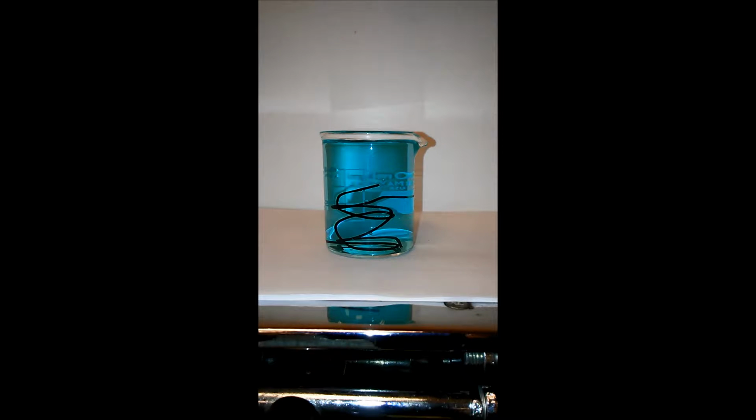Anyway, one thing that we haven't covered yet this year, but we had way back in the past, is that reaction should be balanced. So up here, there's 1 iron, 1 copper, 1 copper, 2 nitrates, 2 nitrates. It's the first one today that I don't actually have to balance because it's already balanced. However, if it forms this one, there's 3 nitrates here and 2 nitrates here, so we end up having to put a 3 there and a 2 there.